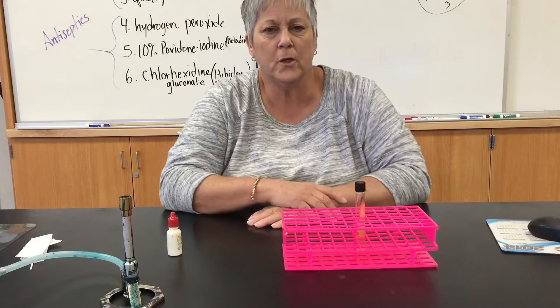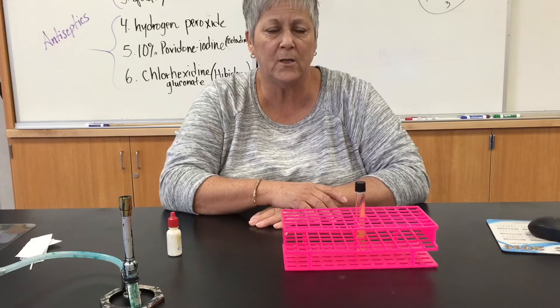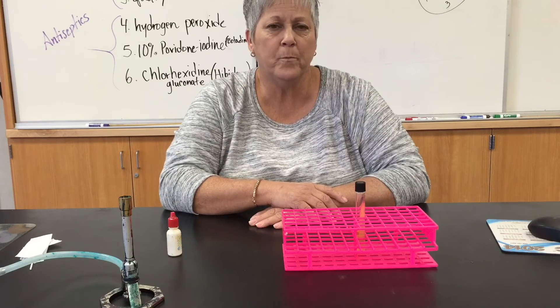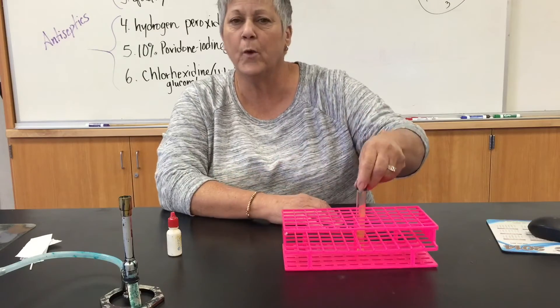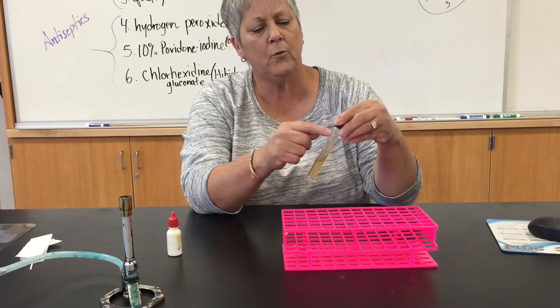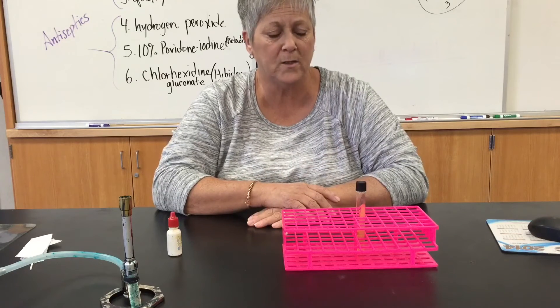The reaction usually occurs pretty quickly. If part of or all of the slant turns dark green, that's a positive reaction. In a very strong positive reaction, the entire slant will turn green. If the reaction is not quite as strong but still positive, you may see green only around the edges of the slant, but either of those reactions would be a positive.